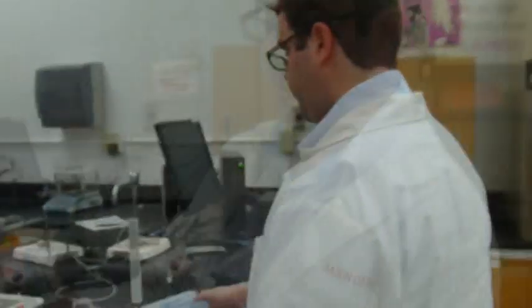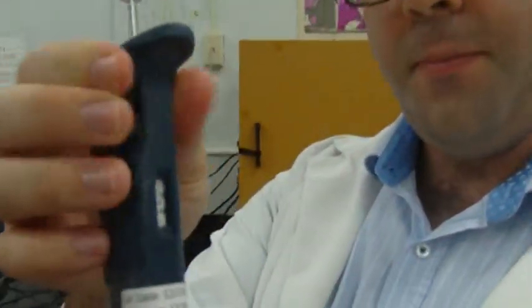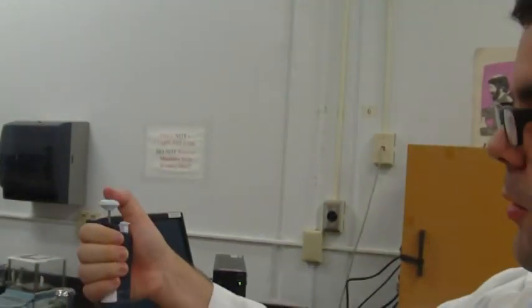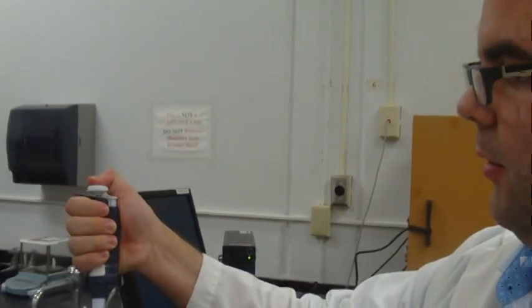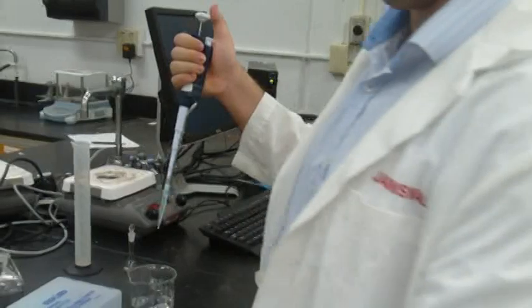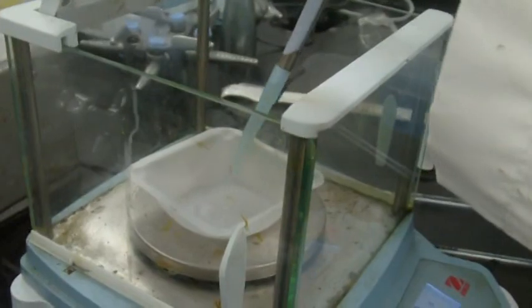Okay, now we'll first do the micropipette. For that we need the micropipette tips. See that it has an adjustable volume? Make sure it's on 1,000. This is 1,000 microliters, or 1 milliliter. With a micropipette, you'll notice that there is one stop and then a second stop. When you pick up volume, you go to the first stop. Pull up whatever liquid you're dealing with, then you can go over here and go all the way down through the second stop.